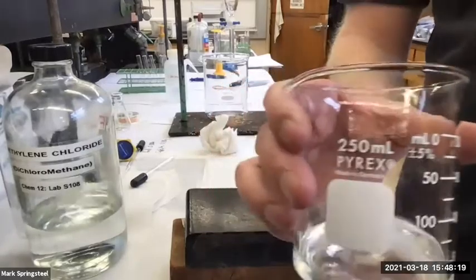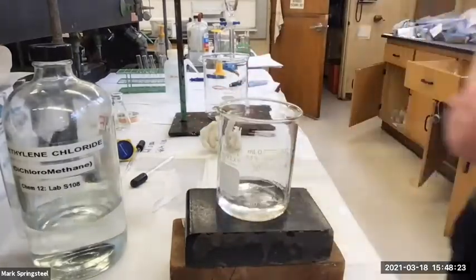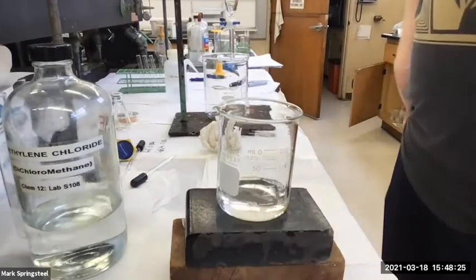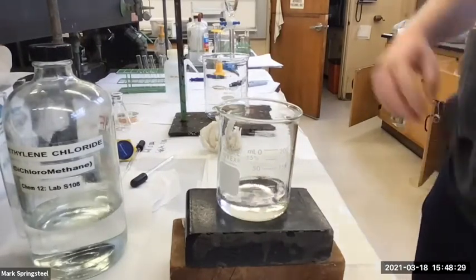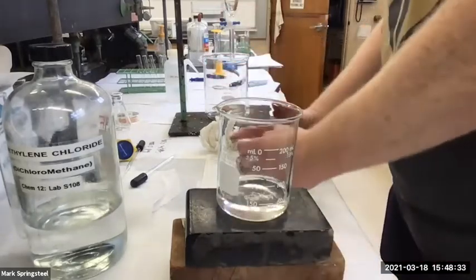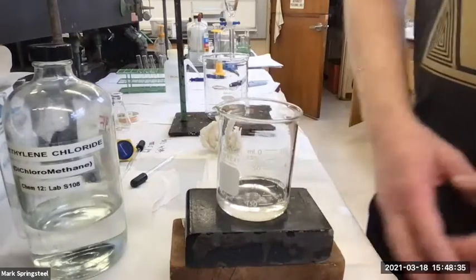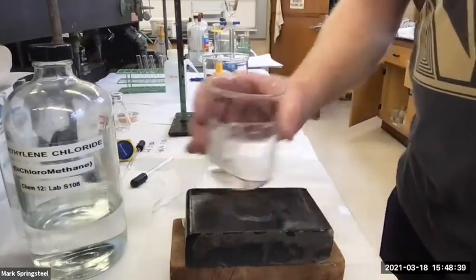We got to see what you do if you don't get the right choice. When you do this experiment on your own in lab, I would tell you to try methylene chloride or diethyl ether. It's mostly luck. If you got lucky the first time, you'd use that solvent. You didn't. So some students wind up using ether, some use methylene chloride. Okay, so I'm looking good.